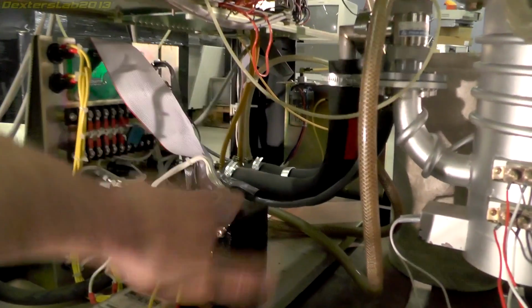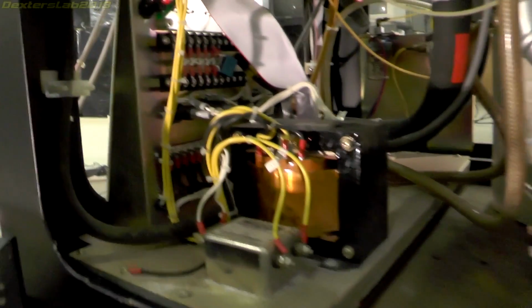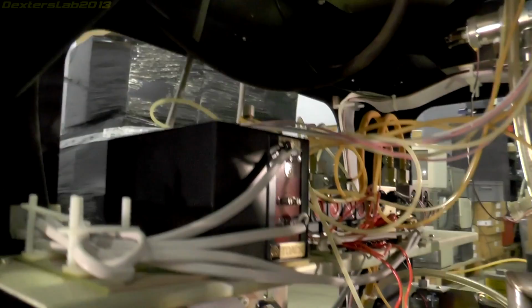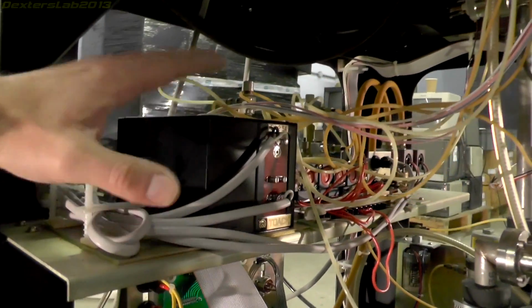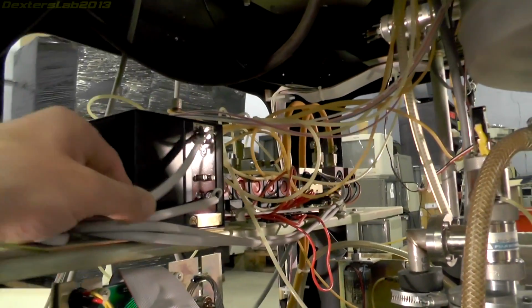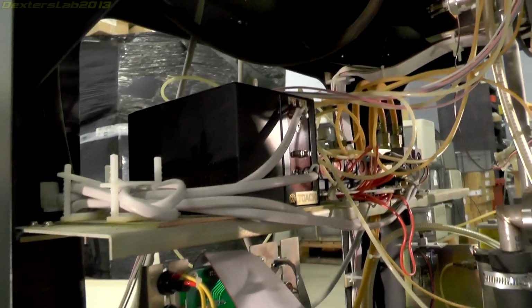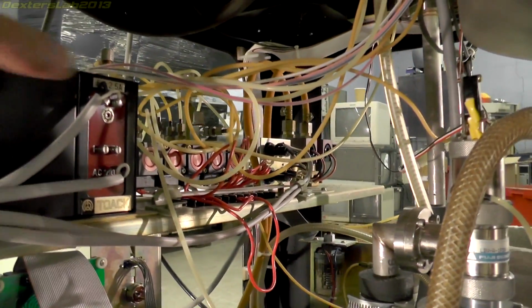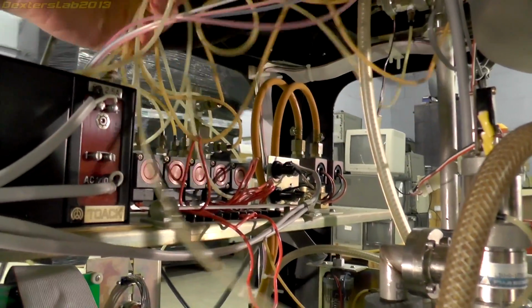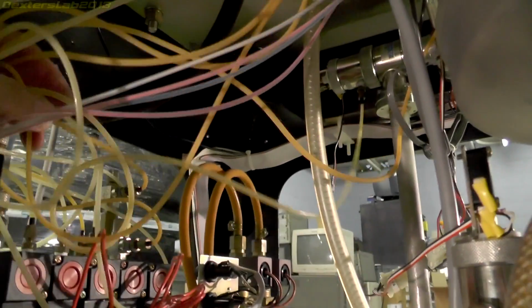Down in here we have a transformer, a load of wiring and stuff in there. This looks like it's a power supply for running the control logic. I'm not 100% on that, but it does appear to be a power supply. There's some piping and switching valves just in there, and a few more over in the back.